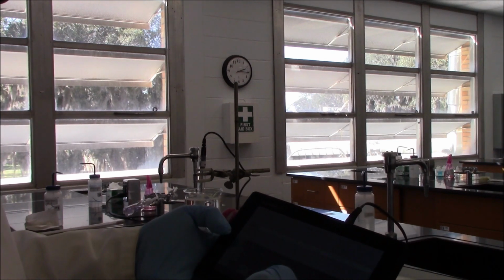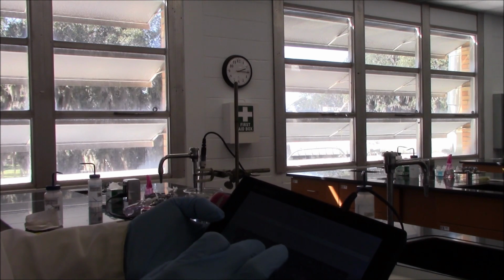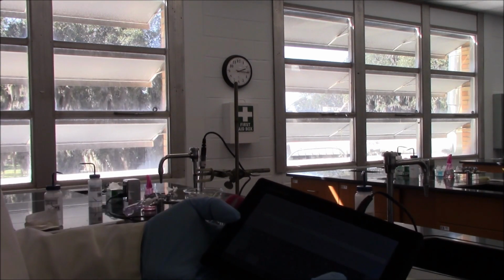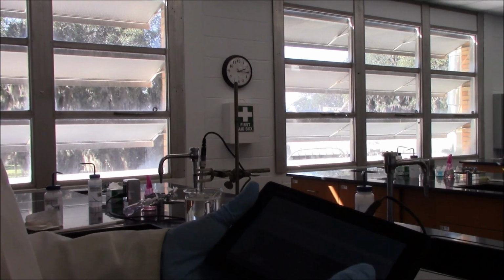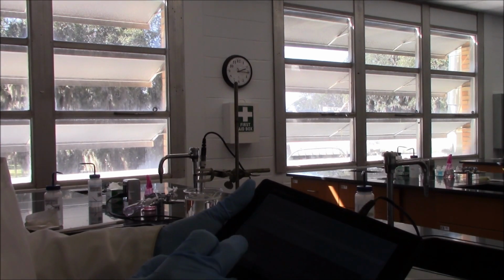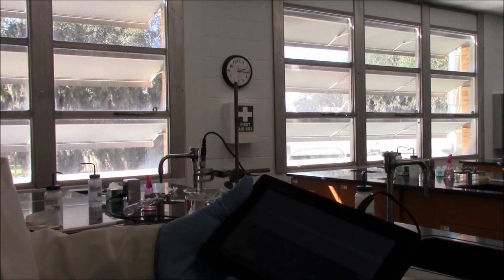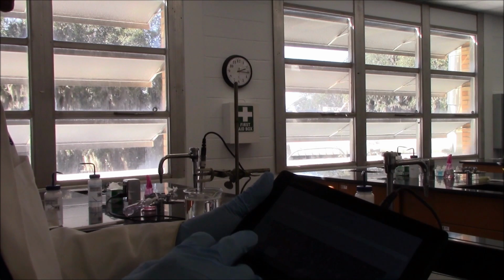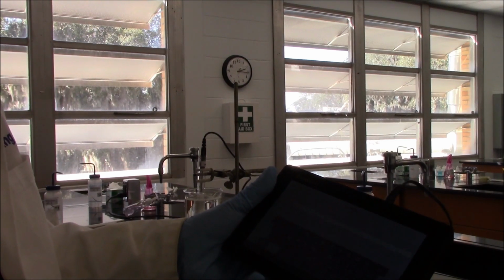I will put my name, Huang, H-U-A-N-G. Oh, I'm sorry, the wrong spelling. But anyway, I will name it this way. And then you put down your experiment number. I don't remember the experiment number. Experiment maybe 4. I click done.